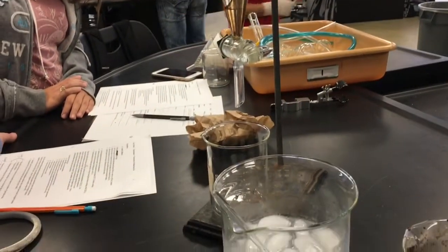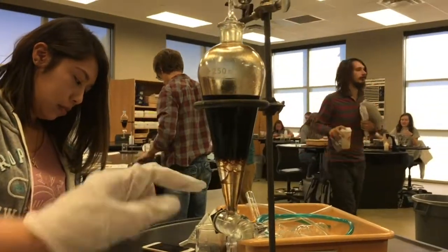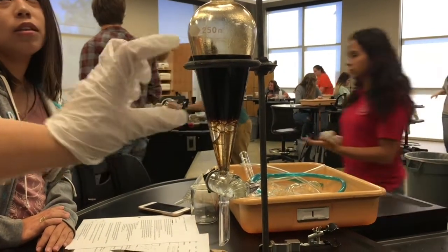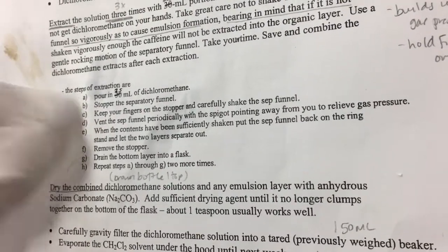Ours is a very distinct V. They have the newer ones on their right. So this is our dichloromethane and this is our black tea, and we're extracting the caffeine from this mess.